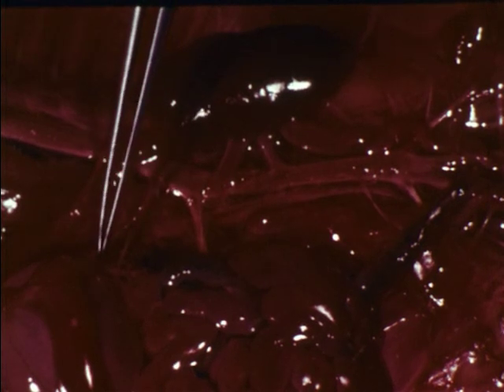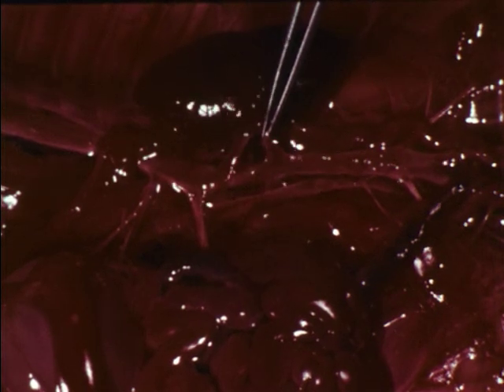For example, these arteries supply blood to the stomach, spleen, and liver. The renal arteries supply blood to the kidneys. In the fetus, there are large umbilical arteries. These extend through the umbilical cord to the placenta.